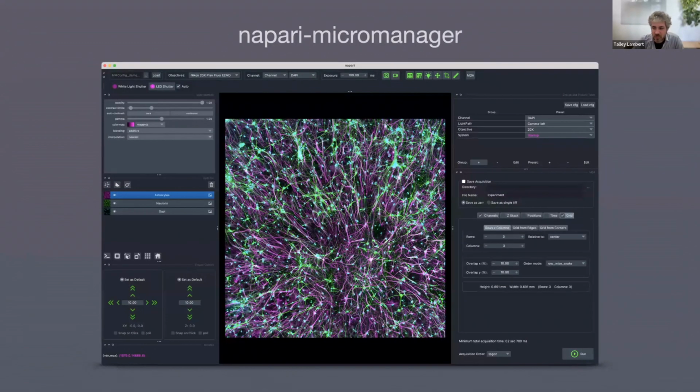This is somewhat recent. It's, of course, changing all the time. Federico is always coming up with the newest and best arrangement of widgets, but in general, it looks something like this. We definitely make heavy use of the dock widget arrangement. There's a toolbar at the top that gives you quick access to many common things. You've got your config to load your microscope config. You can change your objectives, change your channel, change your exposure, hit snap, go live. This will open up the property browser or some illumination widgets. You've got your shutter control here, presets, and a multi-dimensional acquisition widget here. So you can set up how many channels, Z-stack, positions, time, grid, and click run.